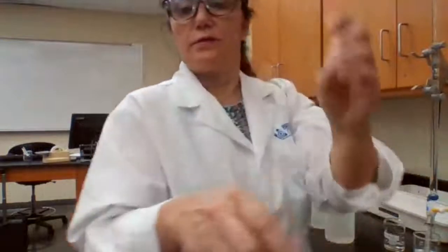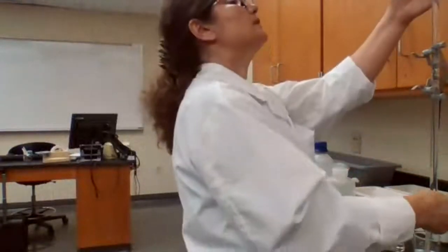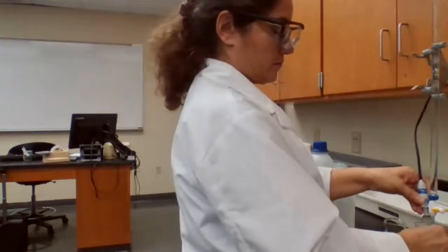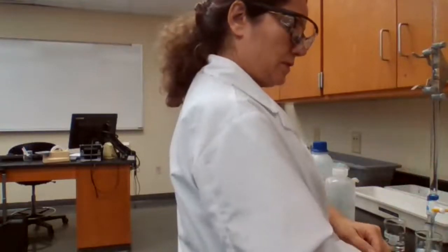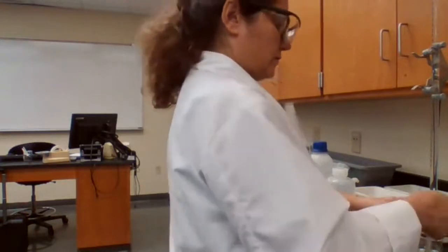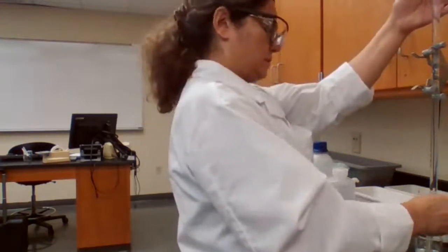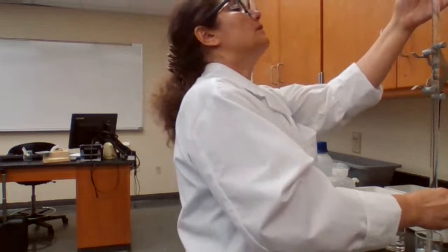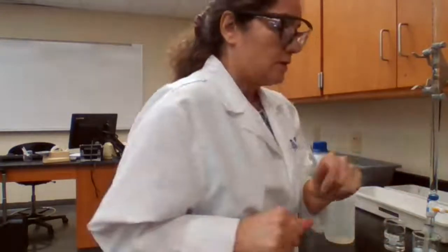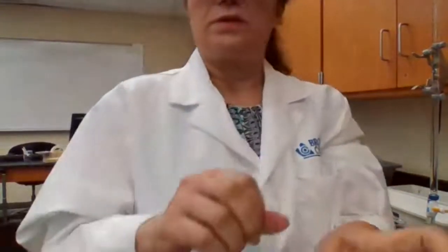Now, 12.5. I'm just writing to have it ready so I don't forget the numbers. 12.5 is 5.7, and 13 is 4.61.